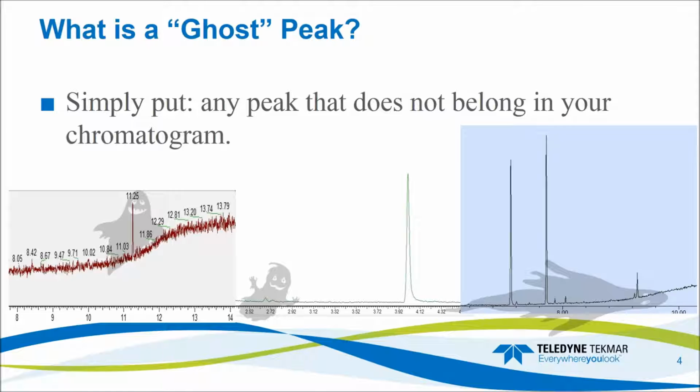In the middle example, we have some internal standard contamination, where we've run an internal standard, and we have a nice sharp peak over here like we expect, but then we also have a couple little guys hanging out over here that don't belong. These might be target compounds, they might not, they might interfere with your calibration, they may not. And then lastly, here on the right-hand side, we have an example of a full system carryover. So we have our internal and surrogate standards, and then we have all these little peaks down here. And so these are a high standard carrying over into the next blank, or potentially a high sample carrying over into what is essentially a non-detect sample and may give you a false positive.